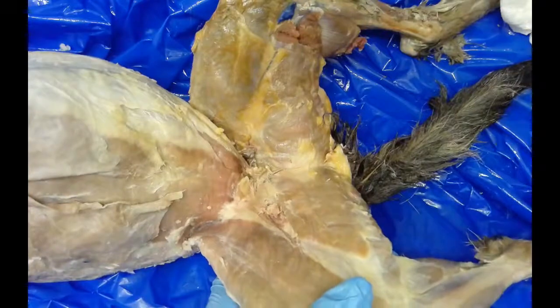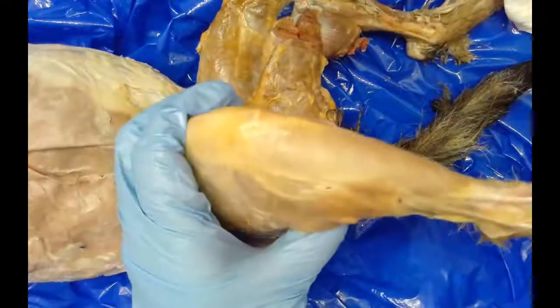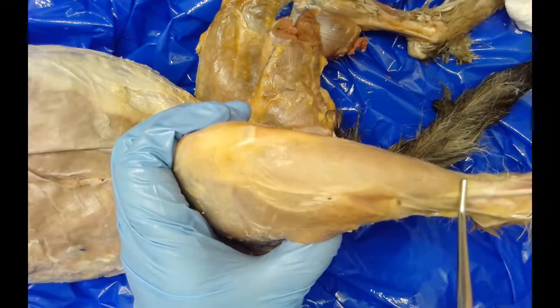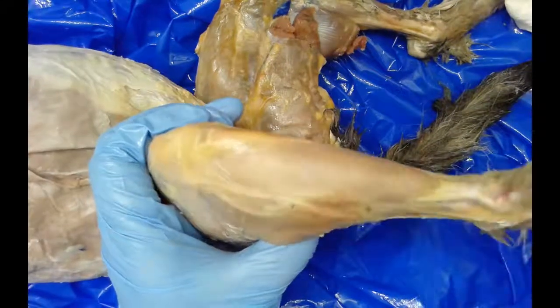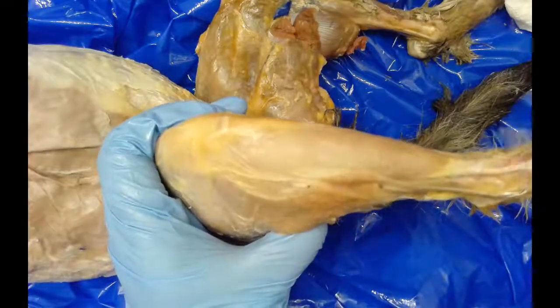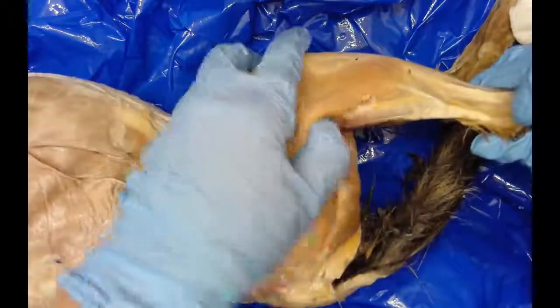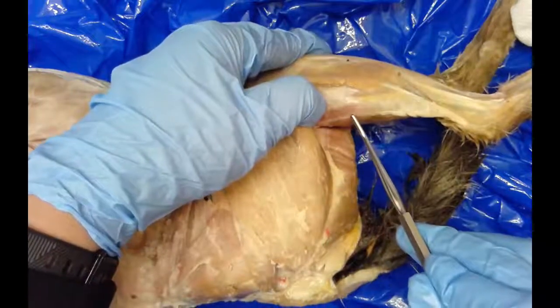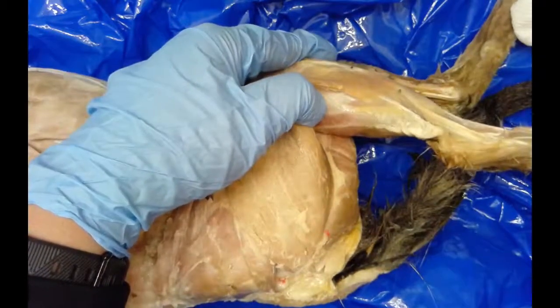The last two muscles are on what would be comparable to our shin. On the front of the lower part of the leg is the tibialis anterior — found on the front of the shin, it flexes the foot, lifting it up. If you've ever had shin splints, this is the muscle that would have been involved. The last muscle, similar to our calf muscle, is called the gastrocnemius, located on the rear of the lower leg. It functions to extend the foot — when this muscle contracts, it pulls the limb and extends the foot out.